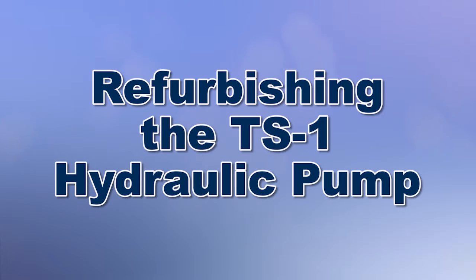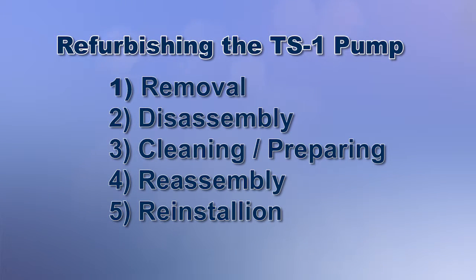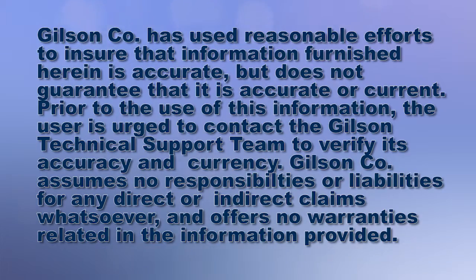Today we're going to demonstrate how to refurbish a TS1 testing screen hydraulic pump with Gilson's Pump Repair Kit number 2, which contains all the internal parts needed to return the pump to working operation, making it a very economical choice to extend pump life.